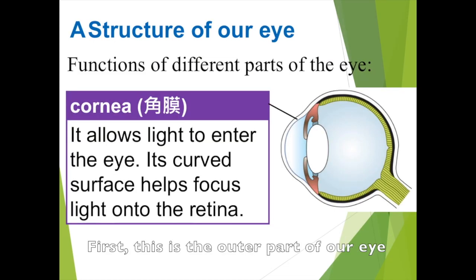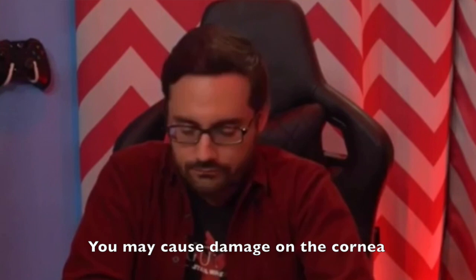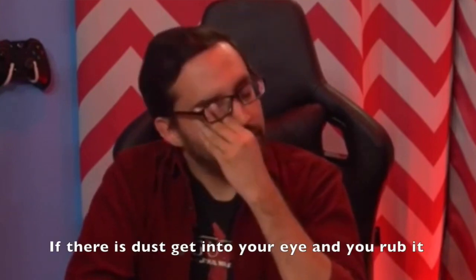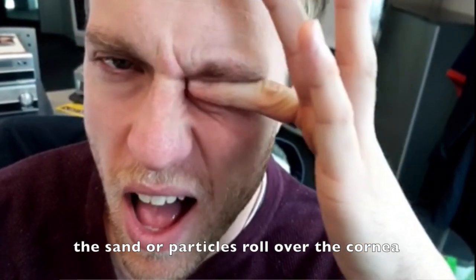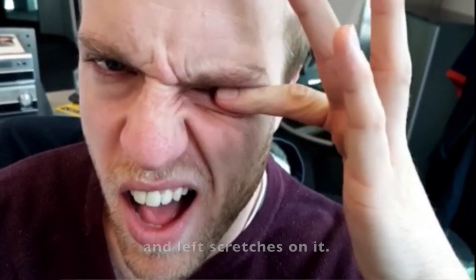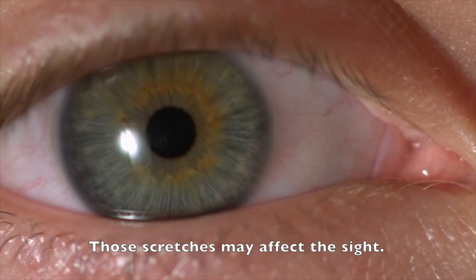First of all, these are the outer parts of our eye. It's called the cornea. It allows light to enter the eye, and it has a curved surface that helps focus light onto the retina. Your parents or your teachers always told you not to rub your eye. That is because if you rub too hard, you may cause damage to your cornea. If sand or dust gets into your eye and you rub it, the sand and dust particles will roll over your cornea and leave scratches on it. And those scratches may affect your sight.